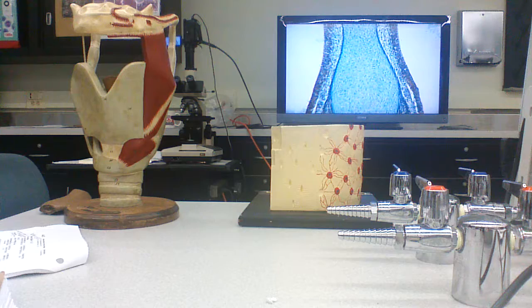And eventually, you have a layer out here in what used to be the perichondrium, which is now the periosteum, and you've got osteogenic cells. Well, the circulatory system comes in here, bores a hole through that bone, and invades the inside, where the cartilage cells have started to die, leaving lots of empty space between them. When the vessels come in, they allow the osteogenic cells access to the inside of that cartilage model.